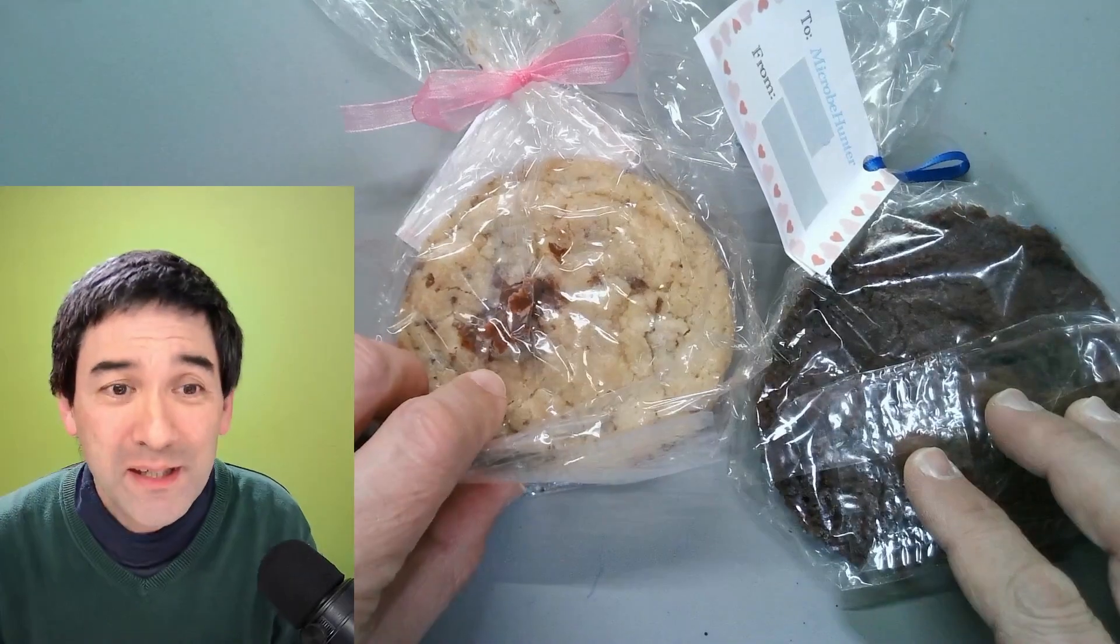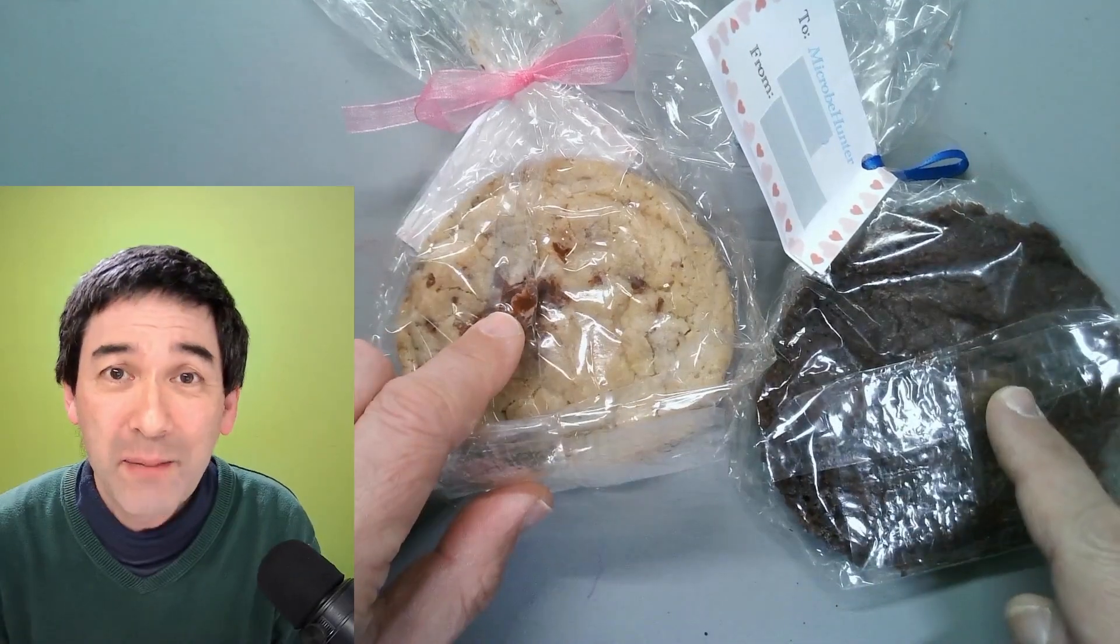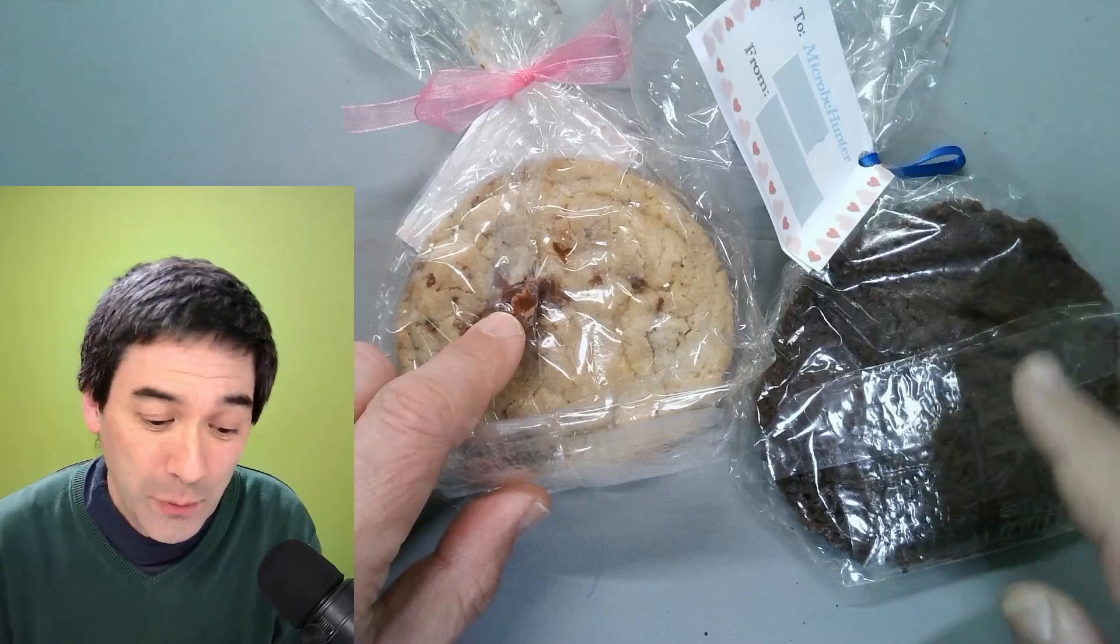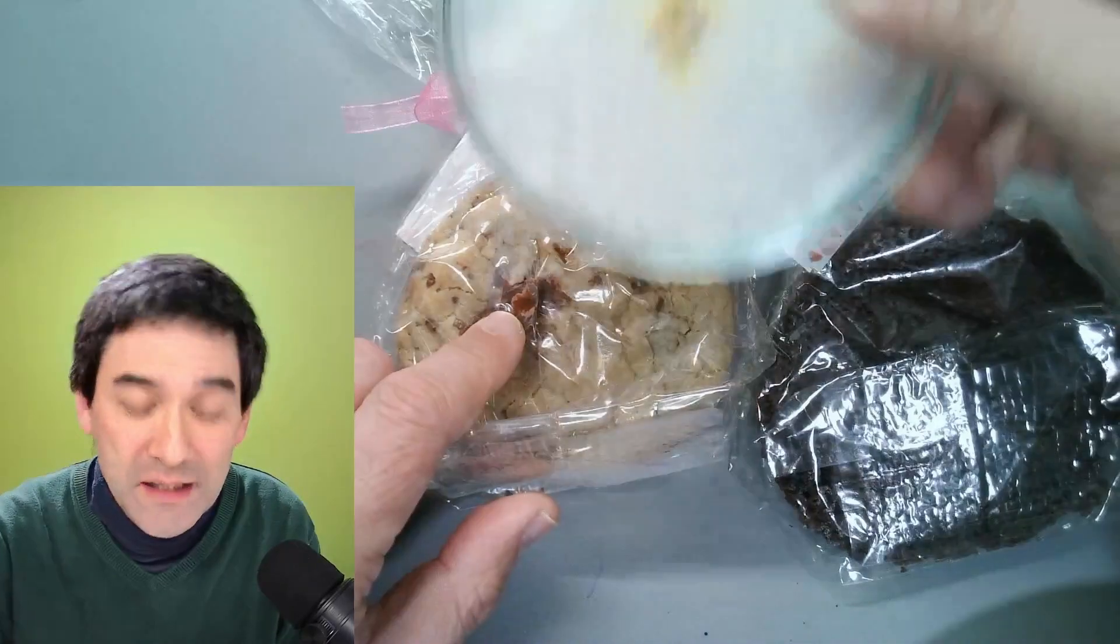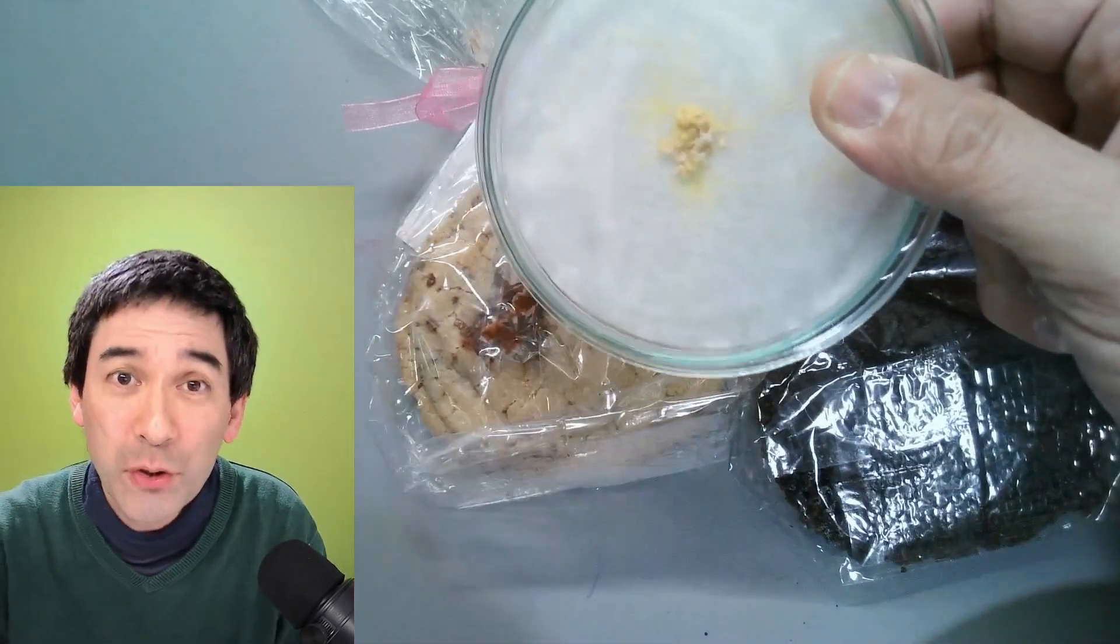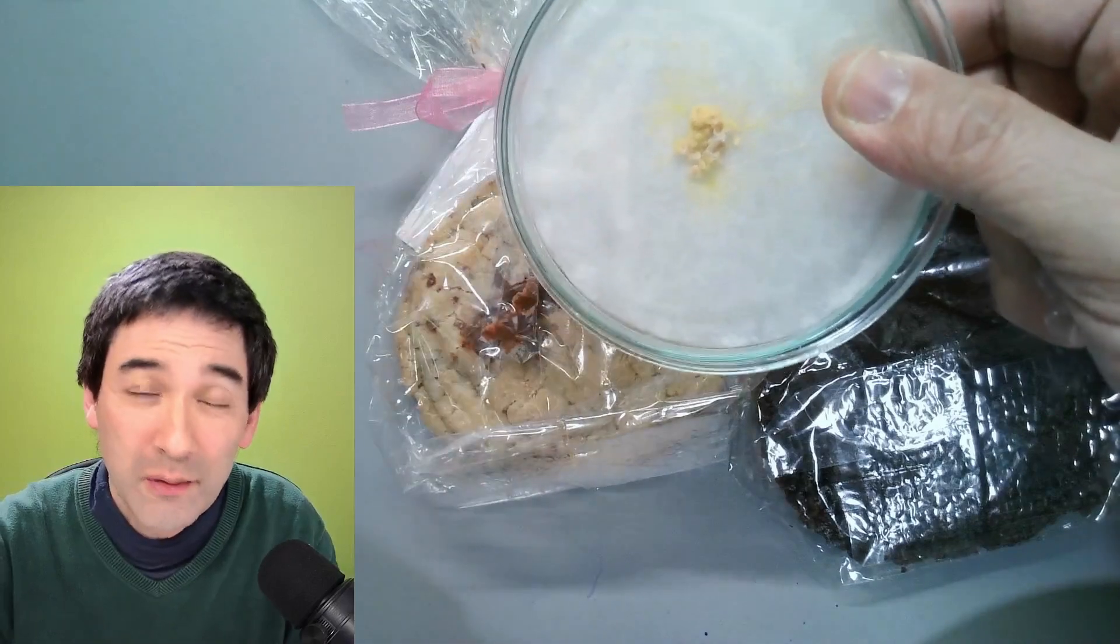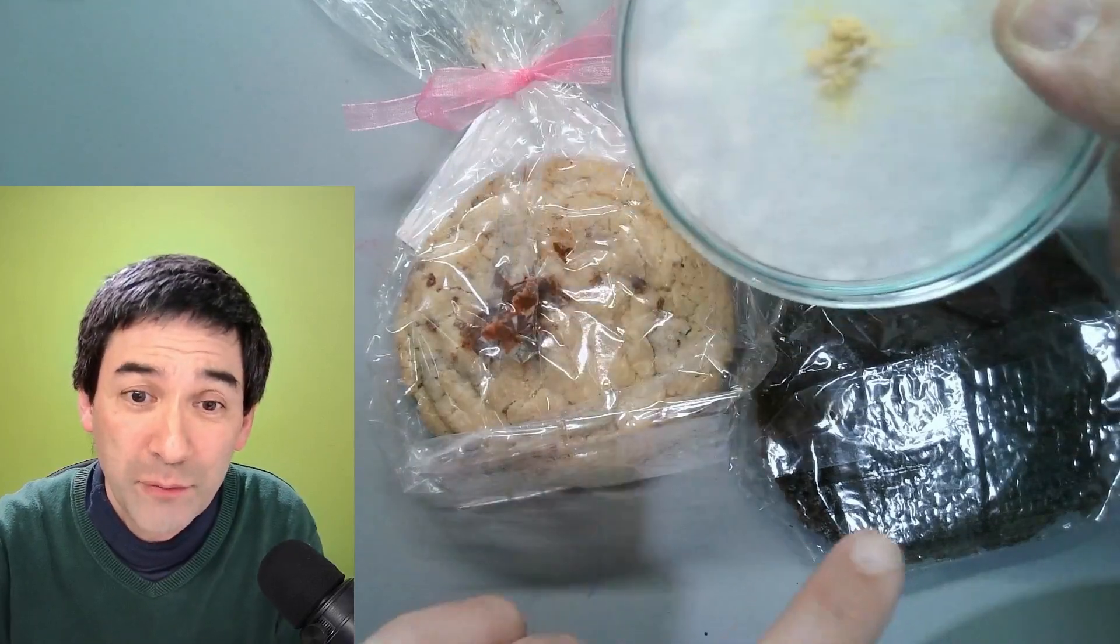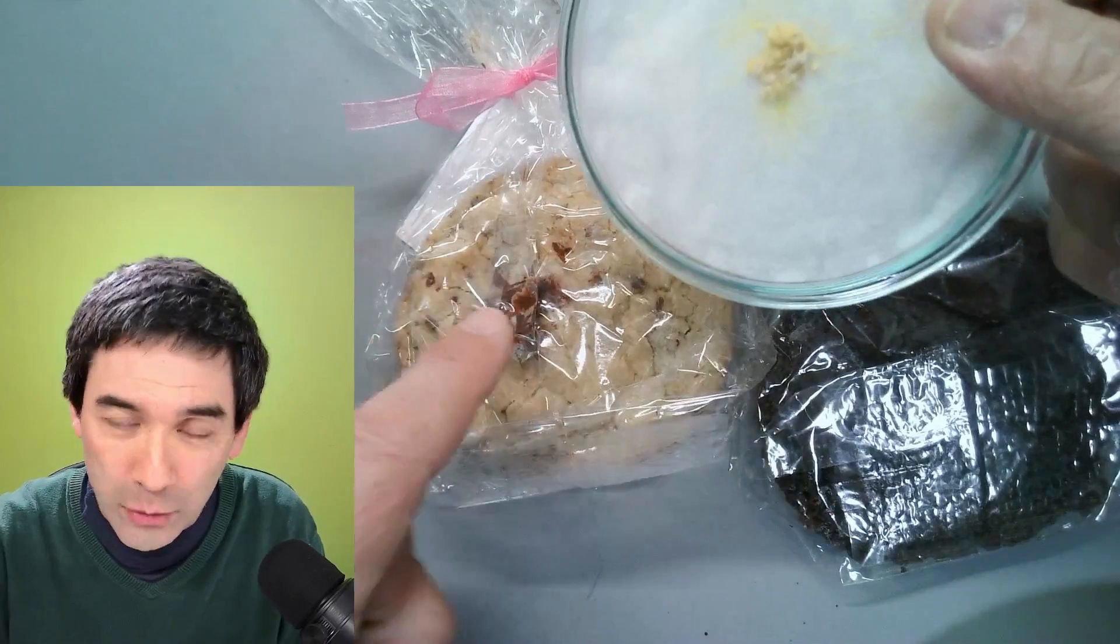What I'm going to do now is unpack those cookies and put them under my stereo microscope. Look what I've got here. This is a slime mold and I'm also going to be feeding both of these cookies to my slime mold and see whether it prefers the chocolate cookie or the non-chocolate cookie.